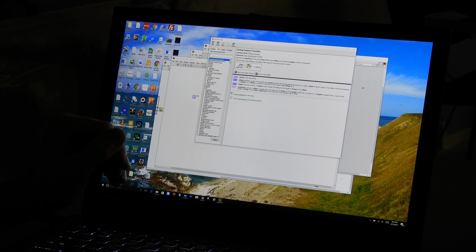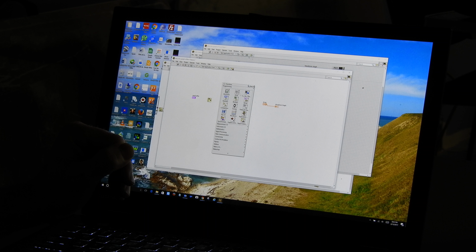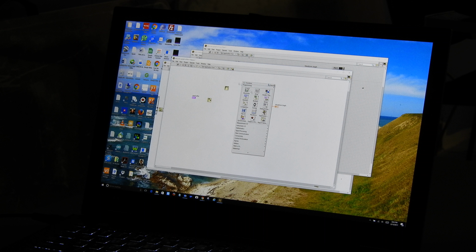Okay, this string subset function returns the substring of the input string beginning at offset and containing length number of characters. Okay, that's not really the function that I want. I want a search. So I need to find a search type function. There's build text, format, search and replace. Okay, search and replace is really not what I want either. Let's see. String subset, concatenate, match pattern. That's what I want, match pattern.